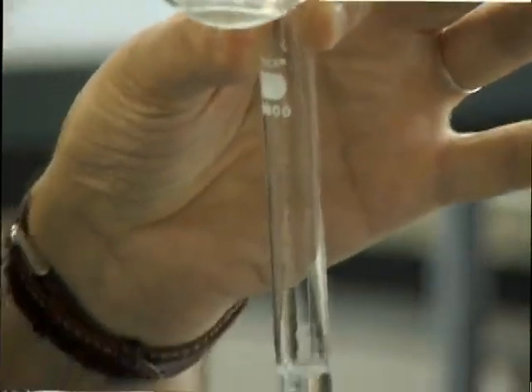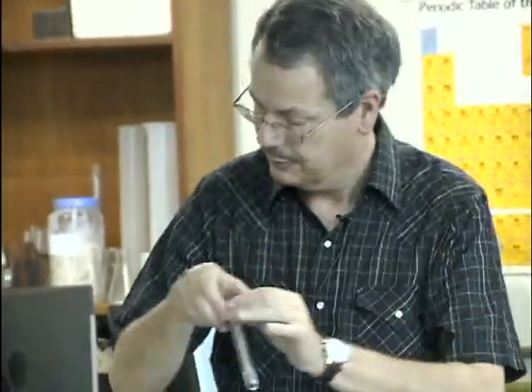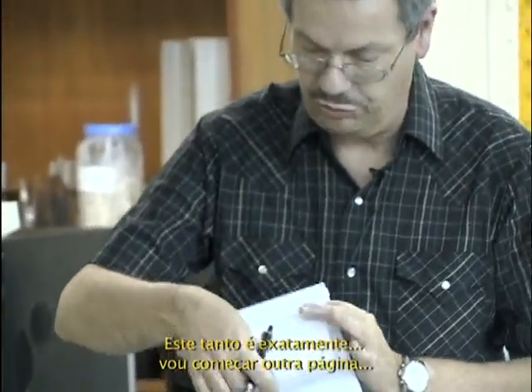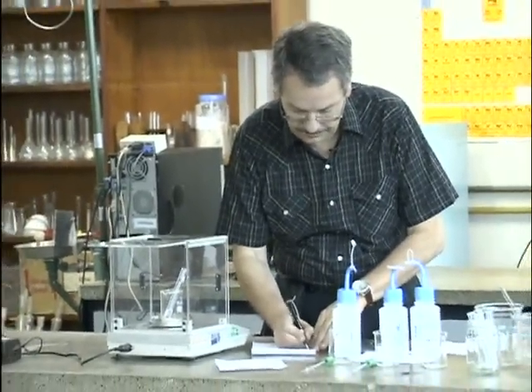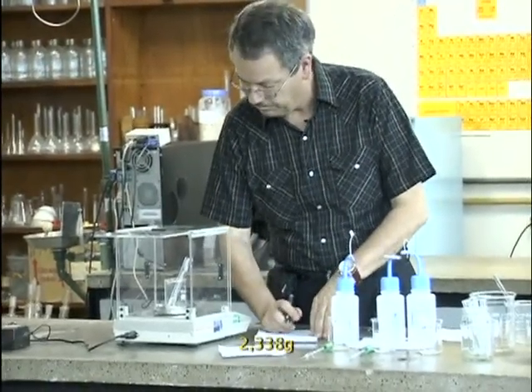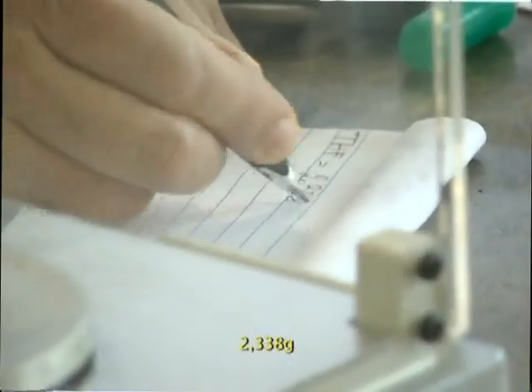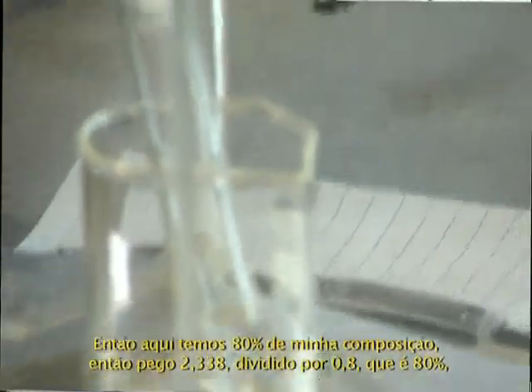That's too much to put everything. This much, for example, will do. This much is exactly, I'll start another page, THF 2.338 gram. So this is 80% of my composition.